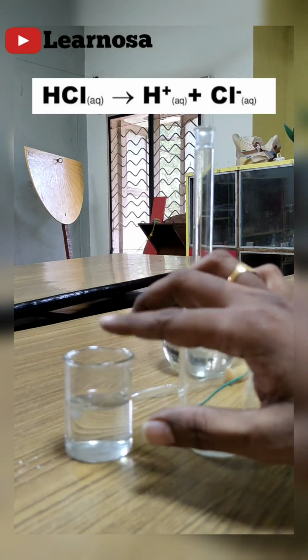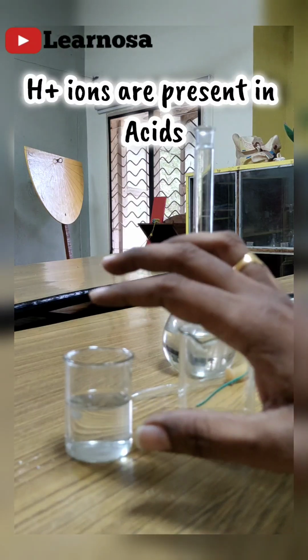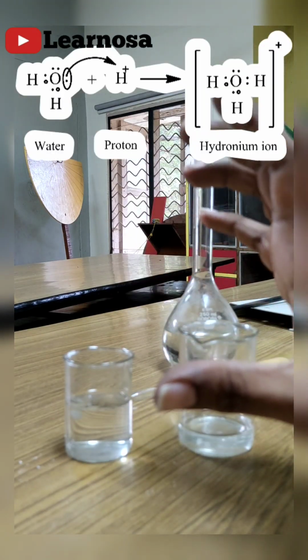So in the first case, hydrochloric acid is a good conductor of electricity. Sodium hydroxide is also a good conductor of electricity. Hydrochloric acid has H+ ions, which are common in acids. If you take any acid, in all acids H+ ions are common. Each H+ ion combines with one molecule of water, so it forms a hydronium ion.